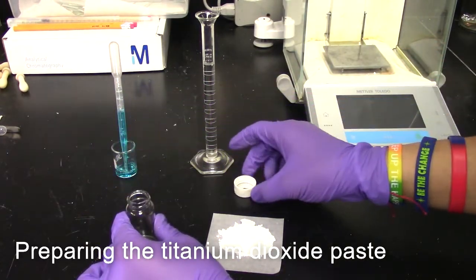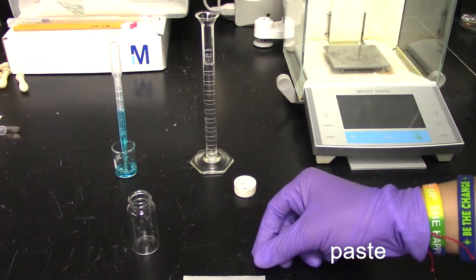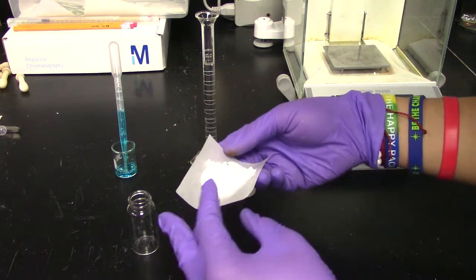Preparation of the titanium dioxide paste can now begin. Carefully take the weighed out titanium dioxide and carefully add it to the vial.